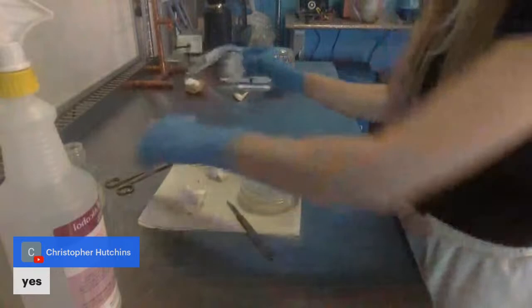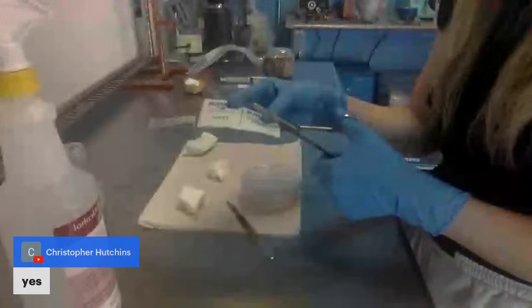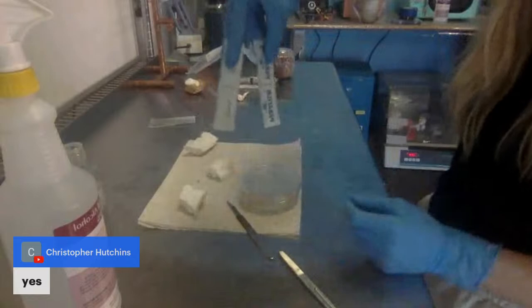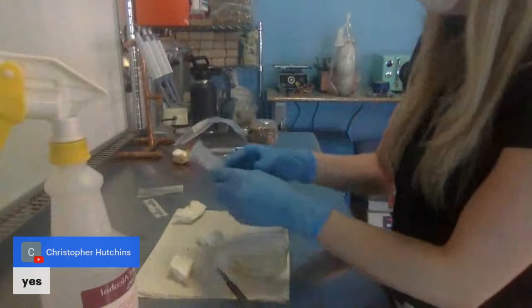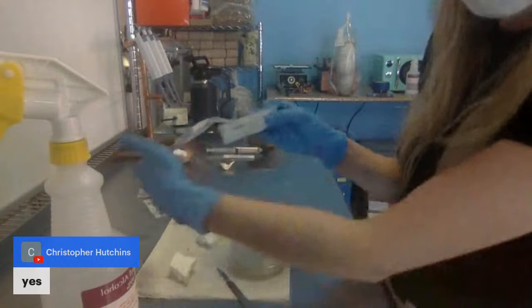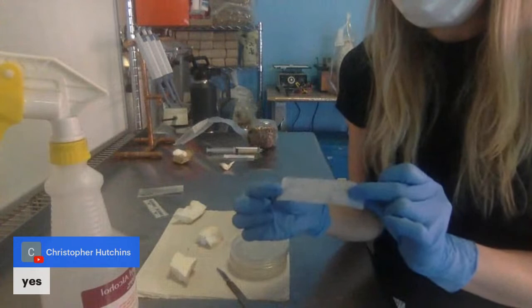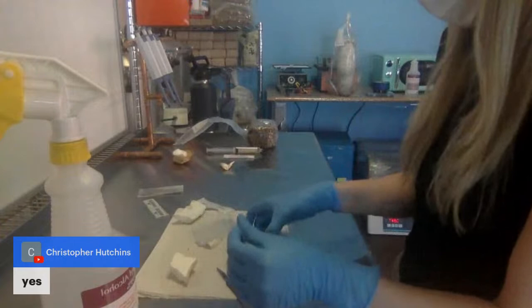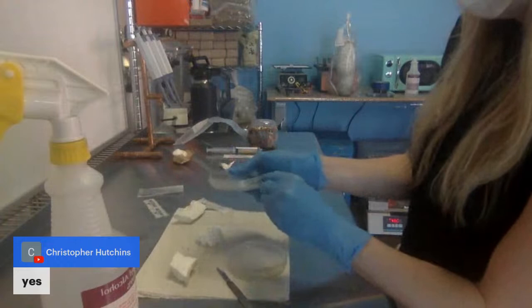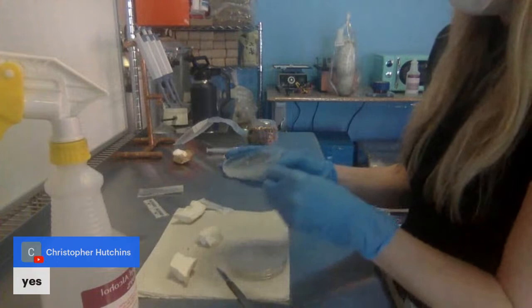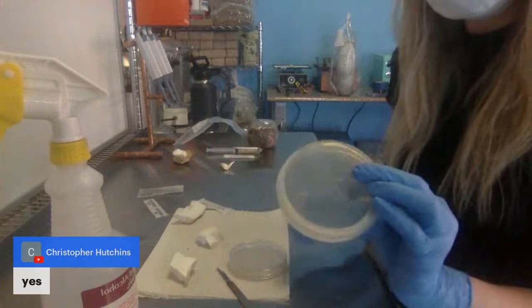Most people with the parafilm strips, you got them in this shape. Cut them once. This is all you need to close the plates. To close it, it kind of works like cling wrap. The part that is against the paper is the part that you want facing the lid. You've got your plate and it should be protected from anything on the outside.